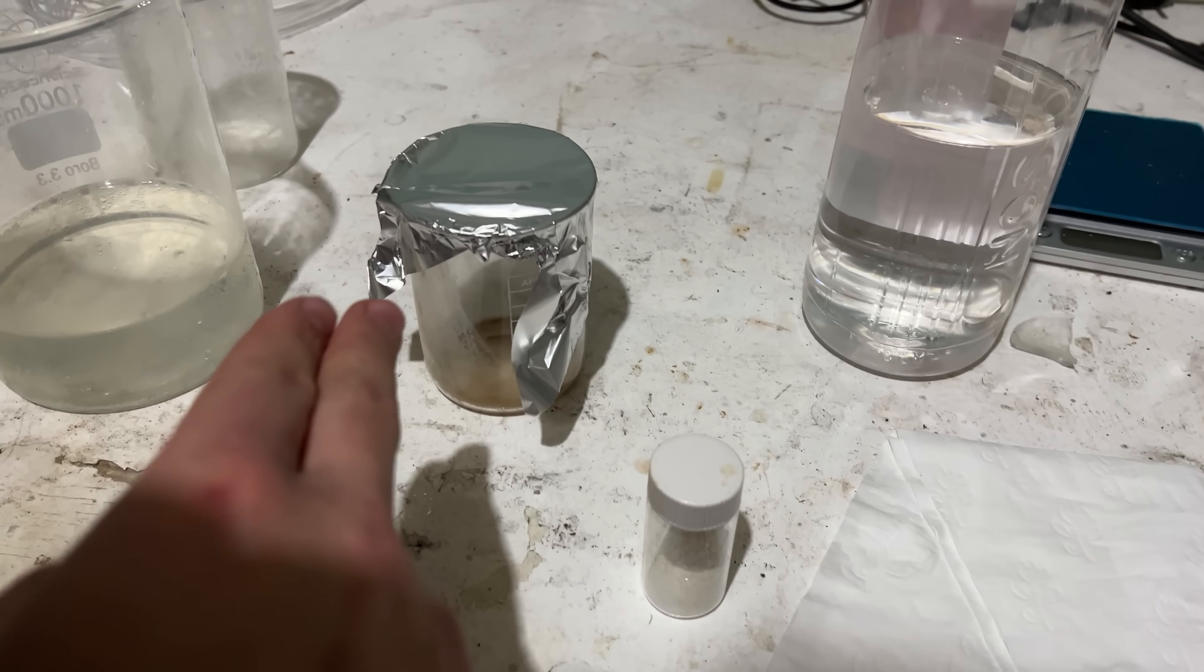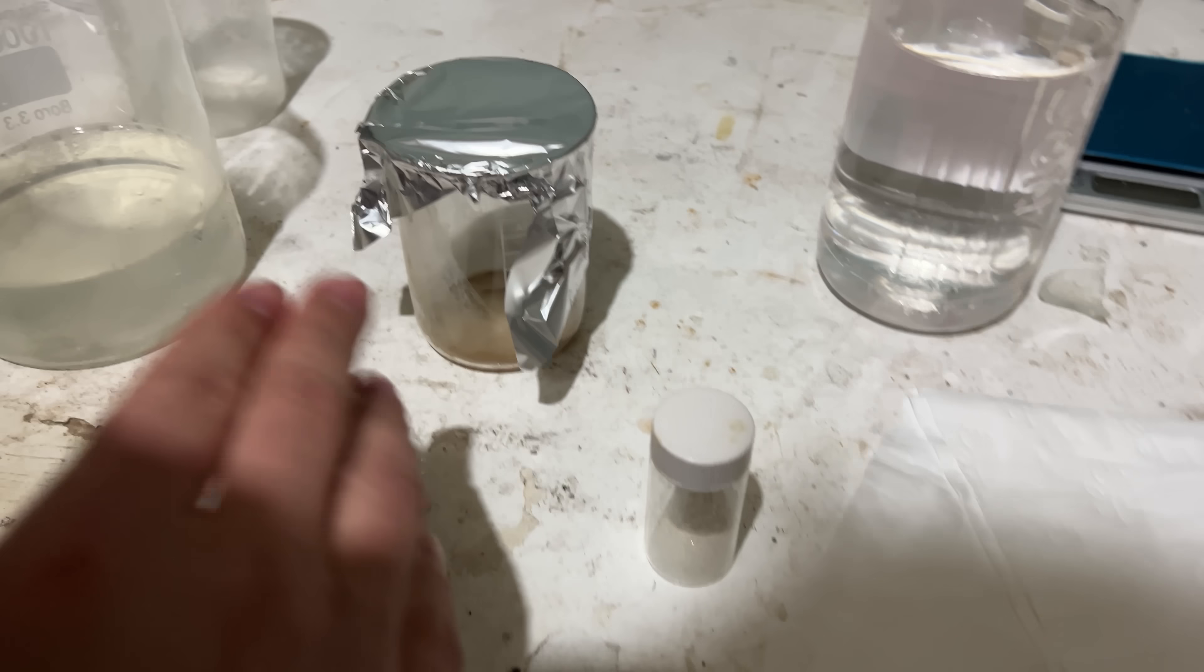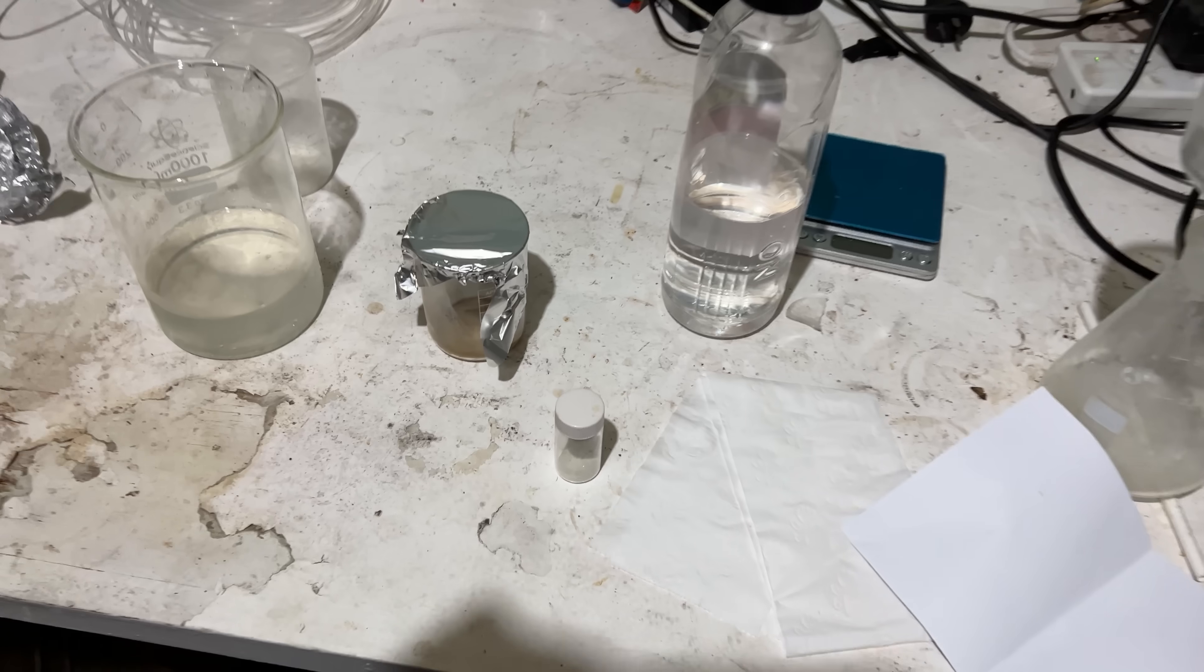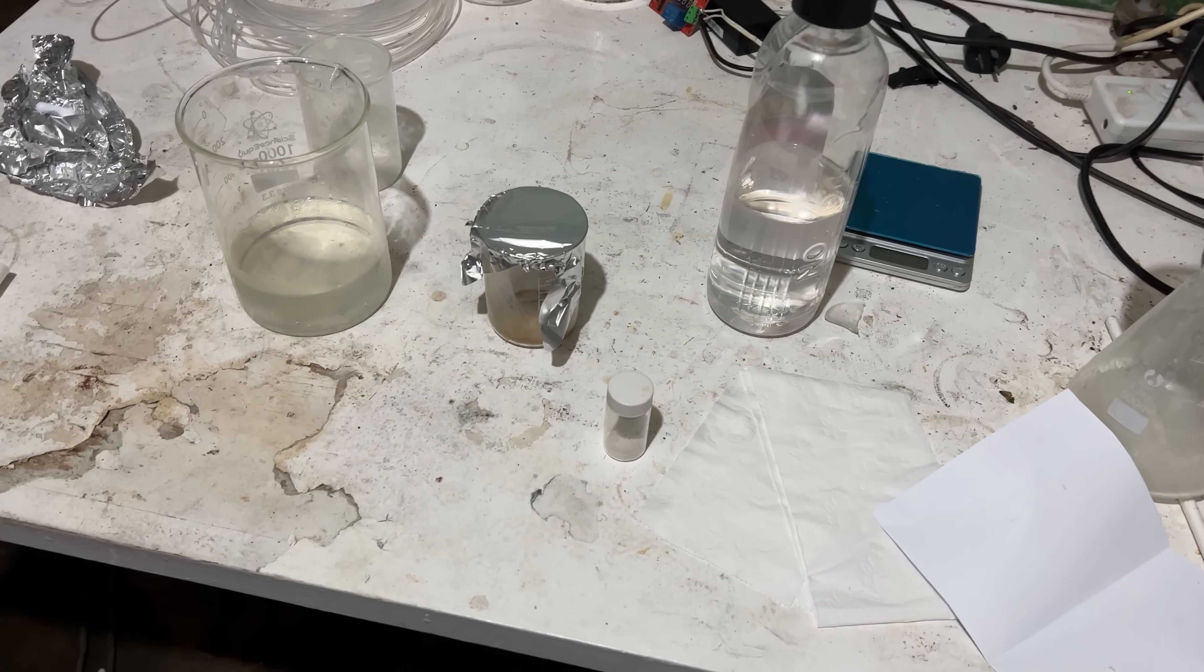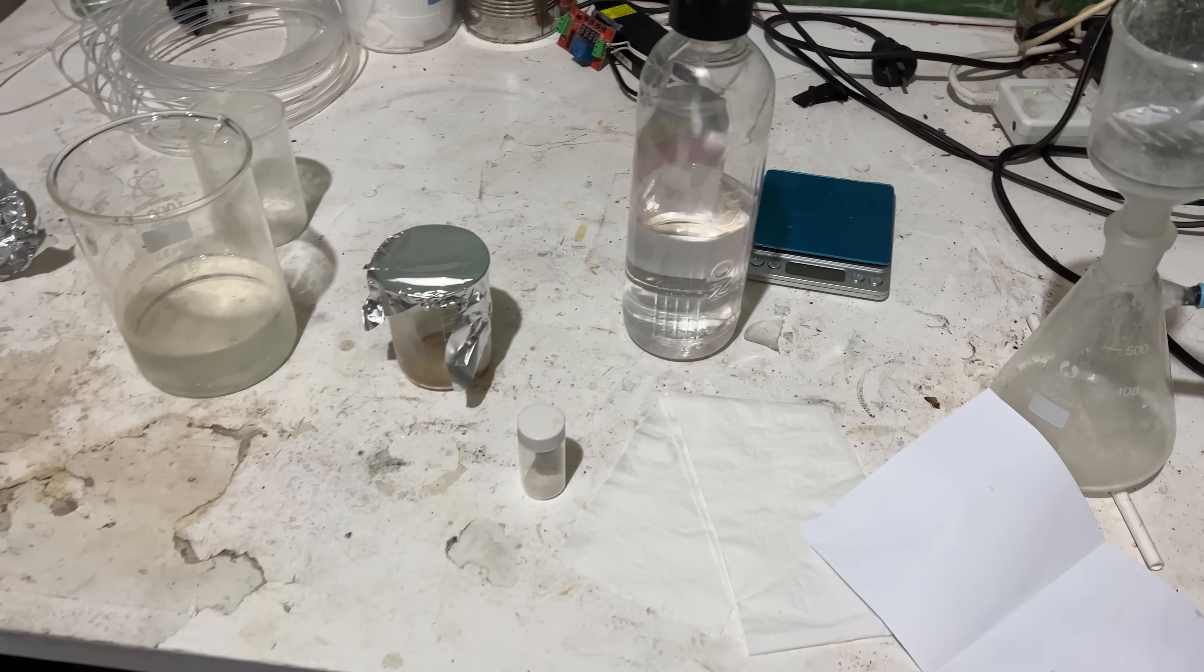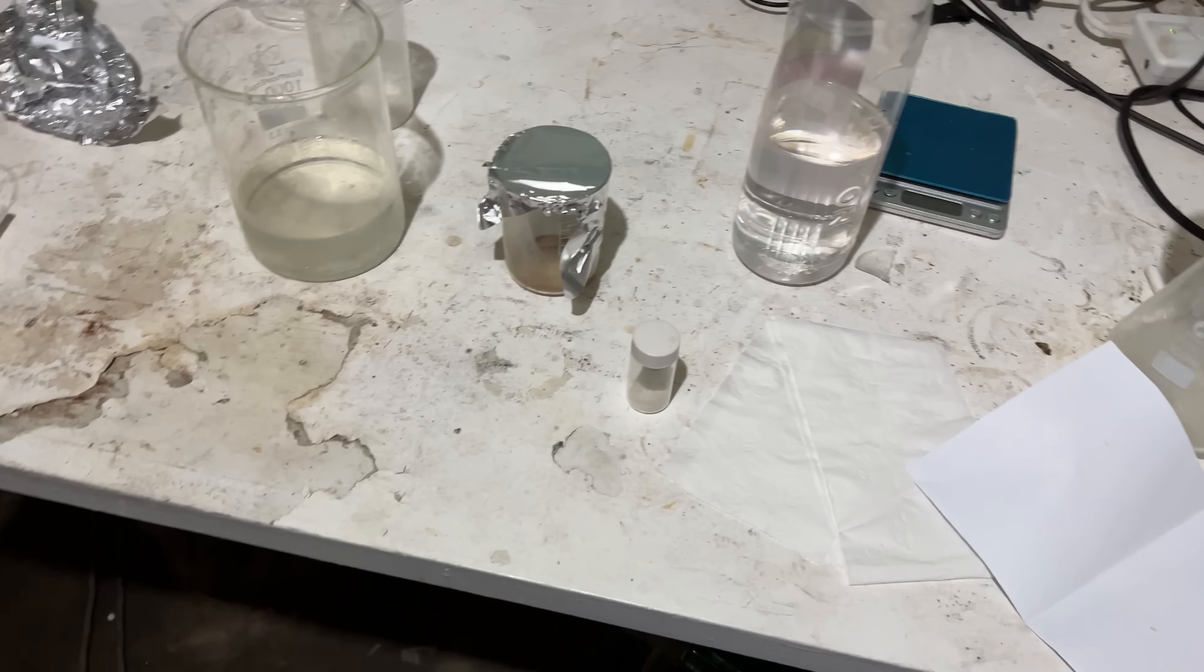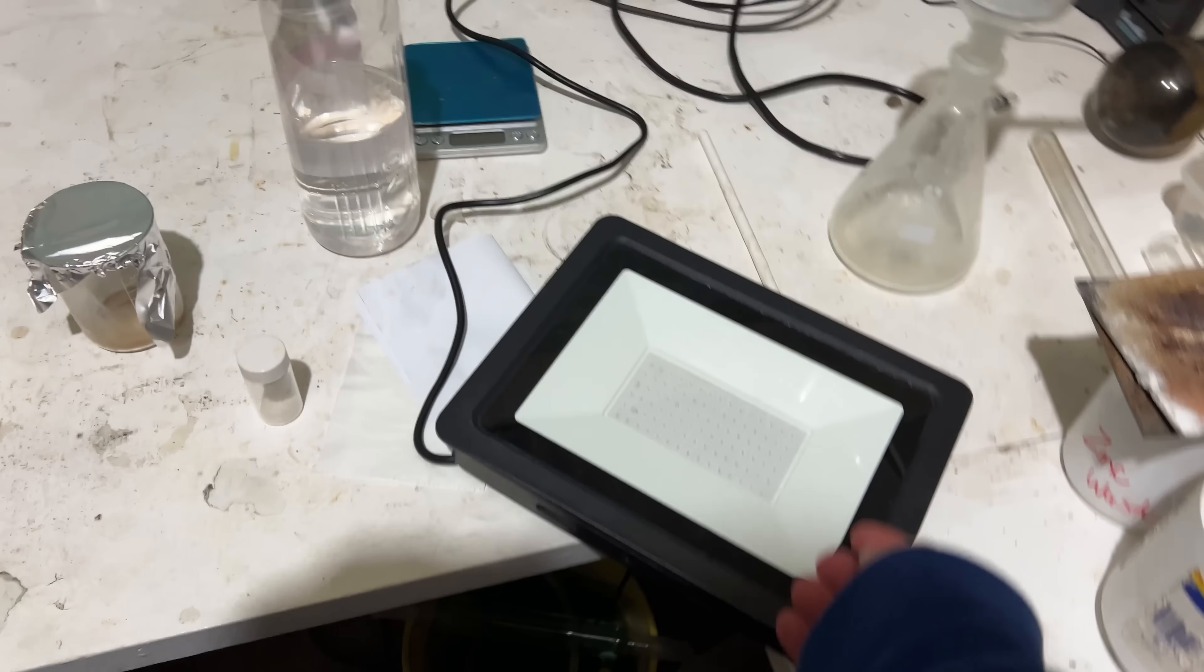But it's really nice when the tar just decides to leave your product and then just lets you decant the product off and leave the tar behind. I'm sure there's lots of diketone left in there, but for the sake of purity, we'll leave that behind. Important thing is we've got some great material to continue on with. So we're back up, as per always, it seems, at the UV step, but feeling very, very enthusiastic about it.